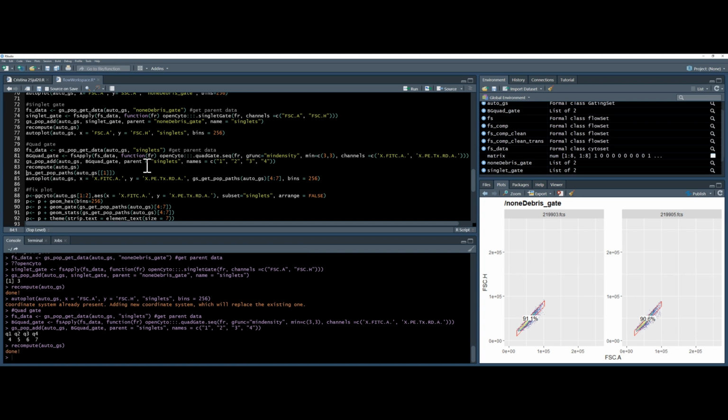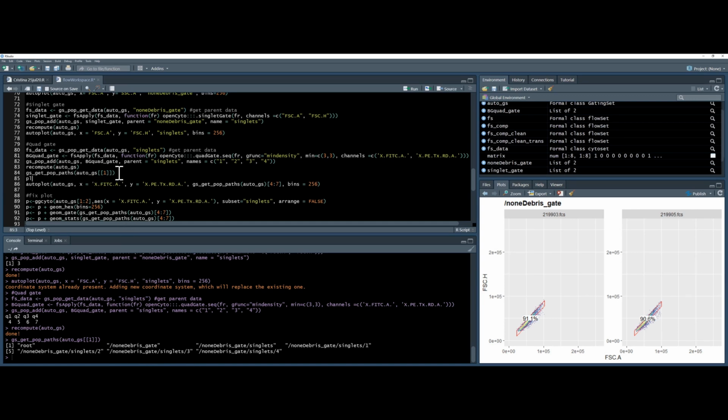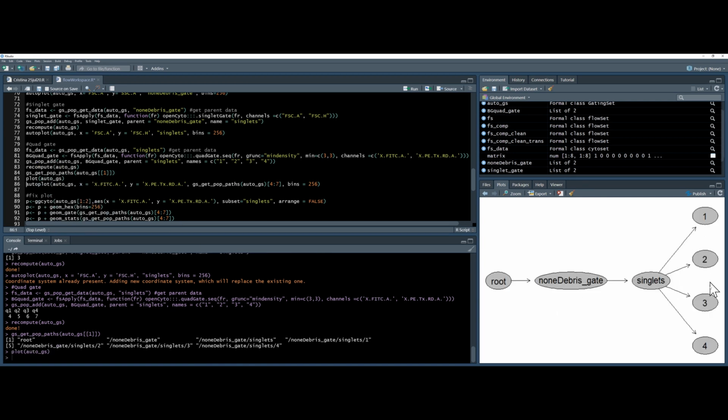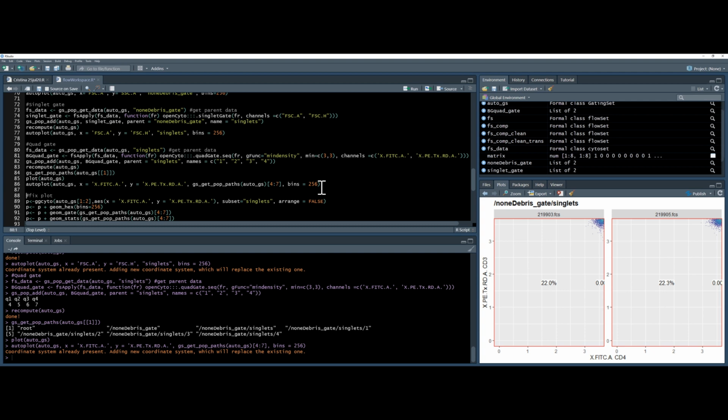Recompute. I can look at the paths and I can see that I now have these extra gates. I could type in plot, AutoGS, and I can see a nice structure, and I can use autoplot to have a look at these gates. So instead of typing in 1, 2, 3, 4, 5, 6, or 1, 2, 3, 4 like this, I'm using the GS get population paths 4 to 7, because it's number 4, 5, 6, 7, so we can see them all at the same time. There's no way to get all 4 quads at the same time without specifically calling them. Now here we have an issue, and we can see that autoplot is not displaying the maximum values properly. It doesn't look great.